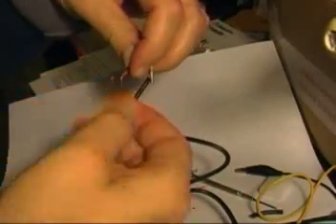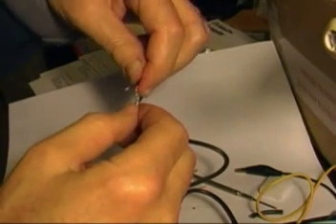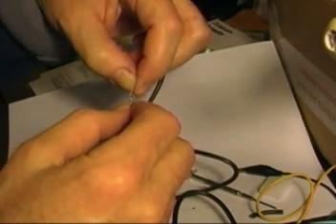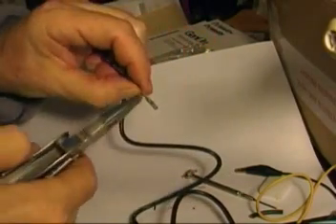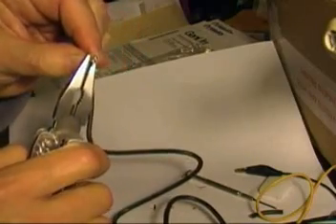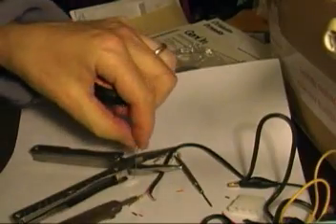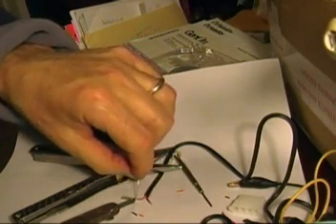I'm going to slide those wires into the pins I was just preparing. I'm twisting the red wire and inserting it into one of the pins through the opening there — there's a crimp opening and then a place where you can solder. I'm trying to get it through the little opening. Here I'm crimping it just enough so that I can solder it without it moving. I'll rest it down, put the soldering iron on it, and get a little solder to melt into the pin as well as the copper wire. It just takes a second.